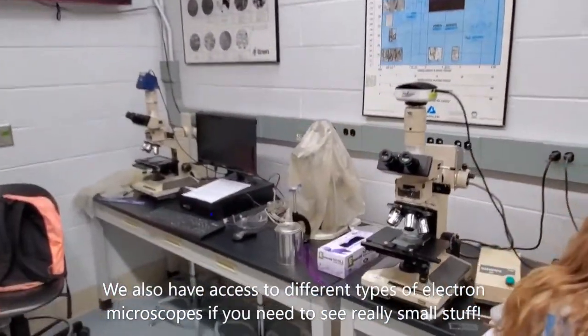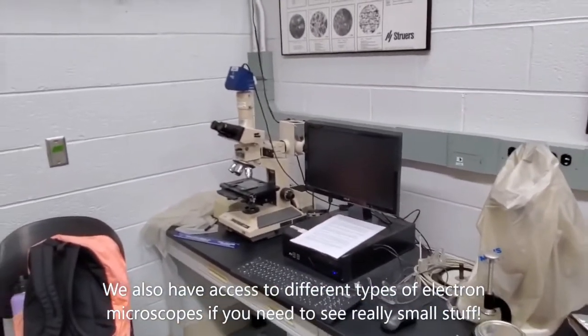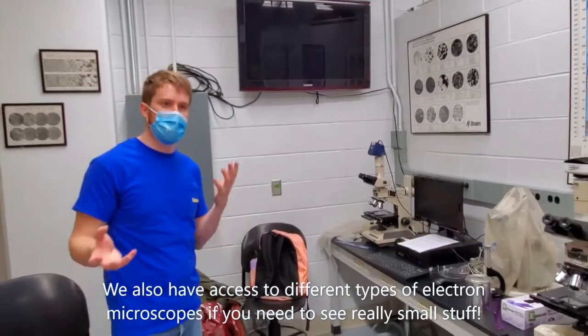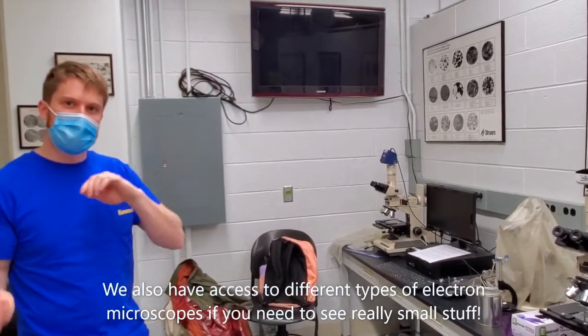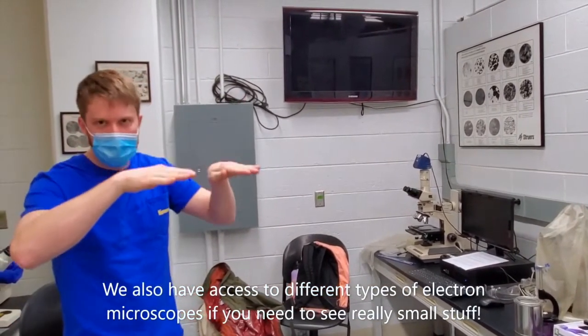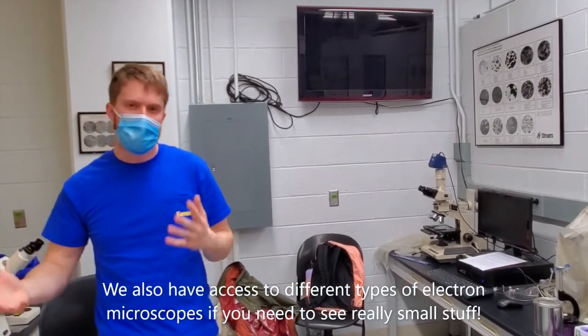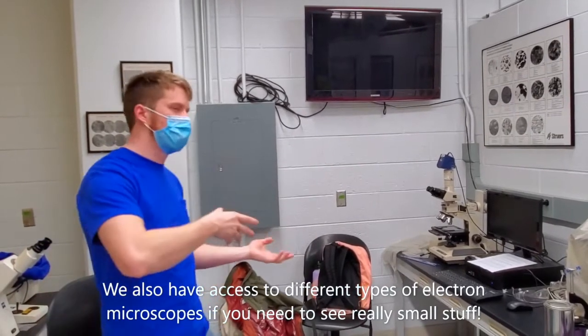Generally to do this, we polish it smooth, and then you can either use polarized light to look at it, and a lot of times we'll do etching. What etching does is you put something on there, like an acid, that actually attacks the grain boundaries of the material. So that gets eaten away more, and then you can see the grains individually standing out. That's important if you're trying to do something with grain size measurement or calculation where you need to know more about the grain distribution.